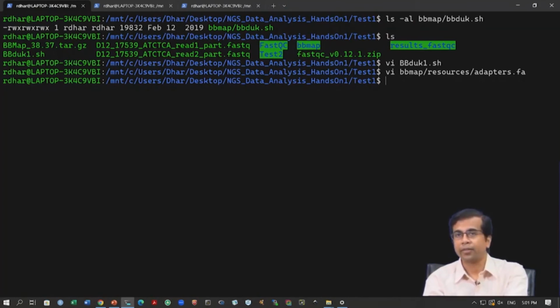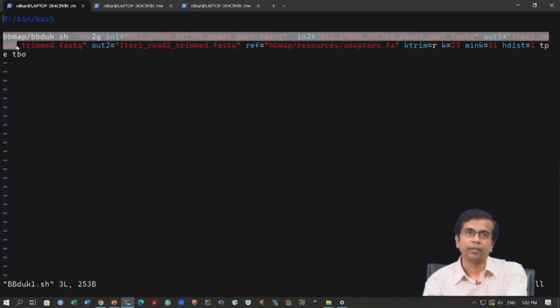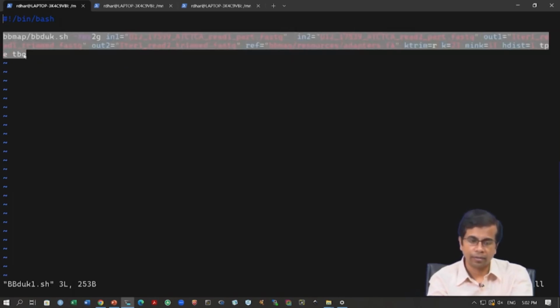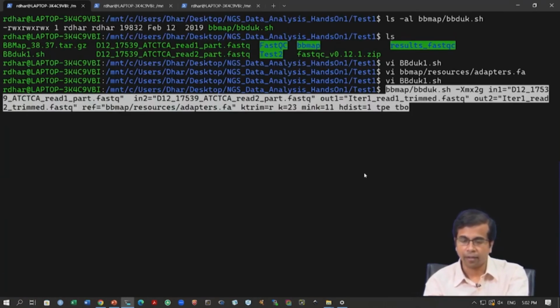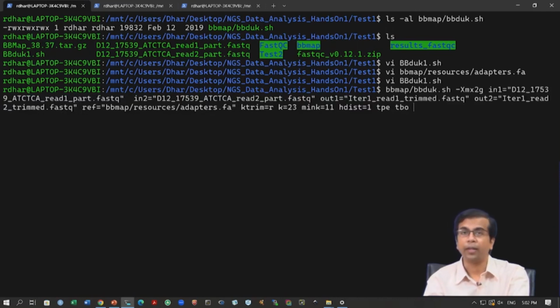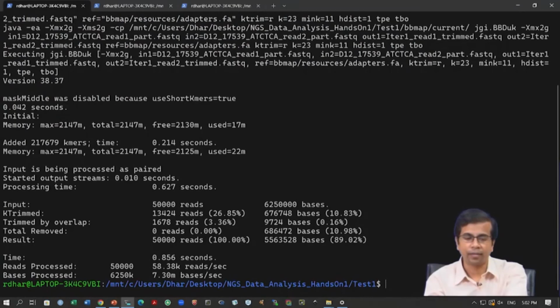We have now seen this adapters file, and we can simply run this now, which will hopefully remove the adapter data. So, let us run this. I will simply copy this and paste it here, and we have understood what each of these commands actually means. So, let us now press enter. The moment I press enter, it will start streaming, and this is done, and you will get certain statistics.